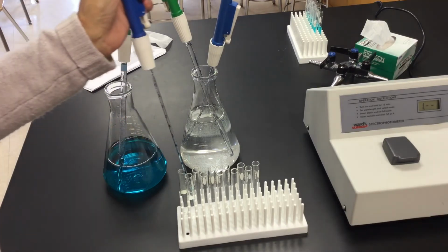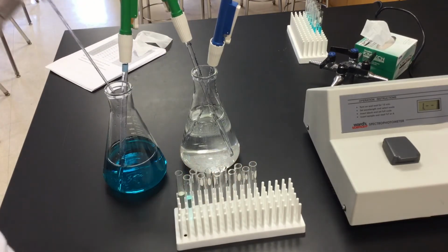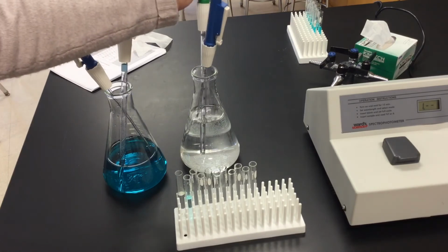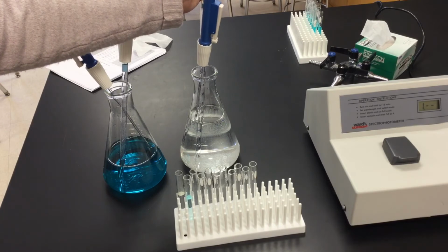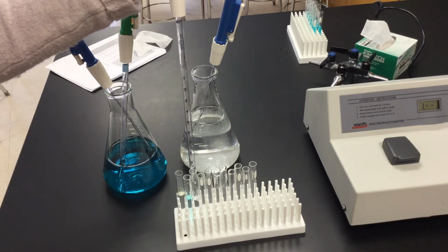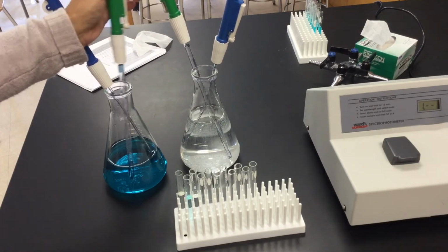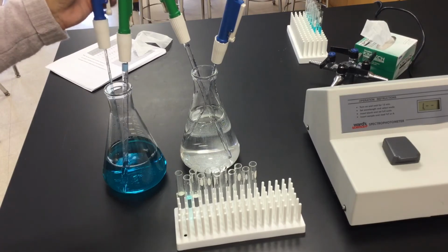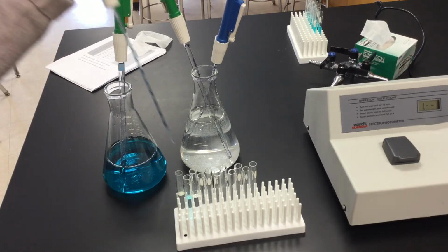Within the classroom, they're going to be working with partners, and I usually suggest one partner do the water, one partner do the copper sulfate. You're going all the way through. Next, I need 4 mLs of water. If you're following your chart, we're going to go 4 mLs of water and 1 ml of copper sulfate. You can use either your 1 ml one, or you can use your 10 ml one. We're just going to measure our 1 milliliter of copper sulfate. That's going to go into tube 3.